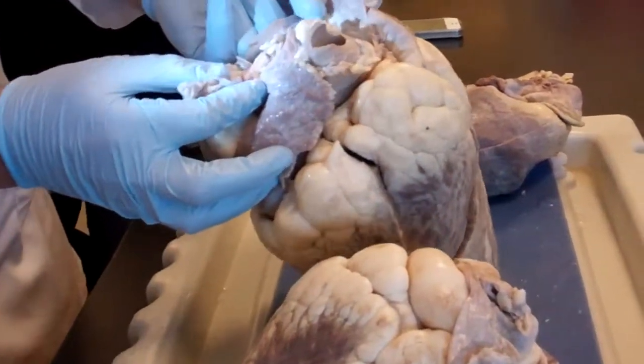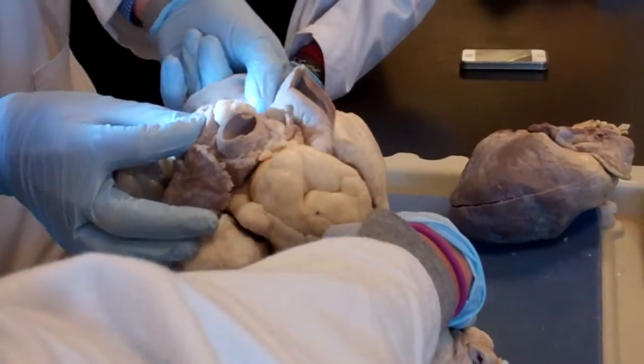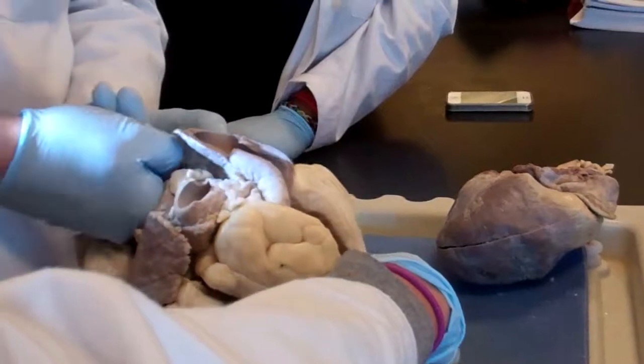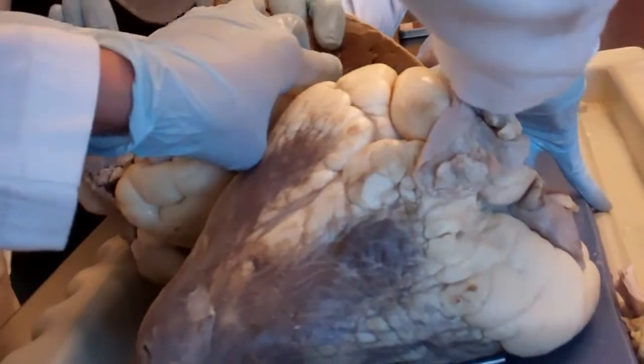You see those pockets there? No, aim it properly. I want you here. See those flaps? Let's put it from this side. You see where my fingers are playing? You need to come from this side.